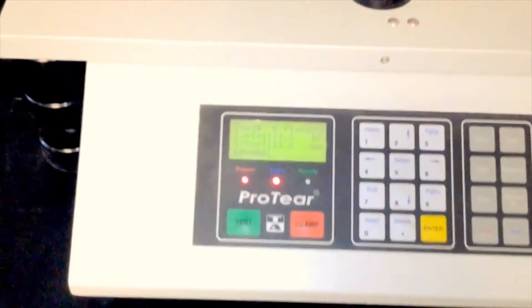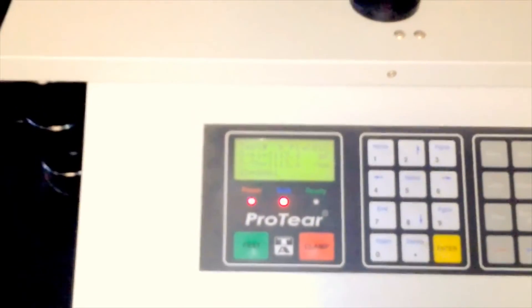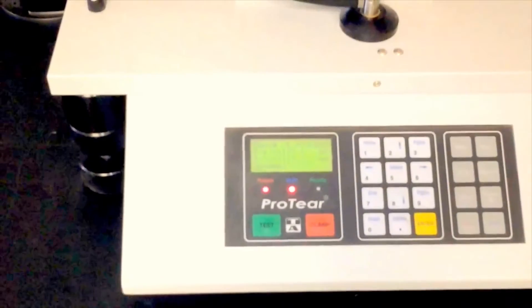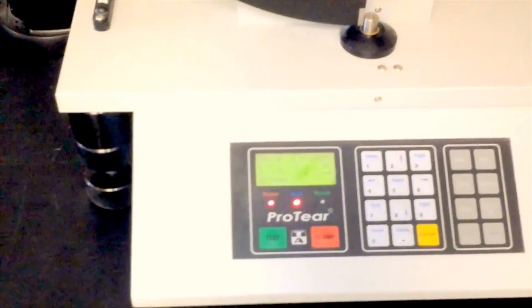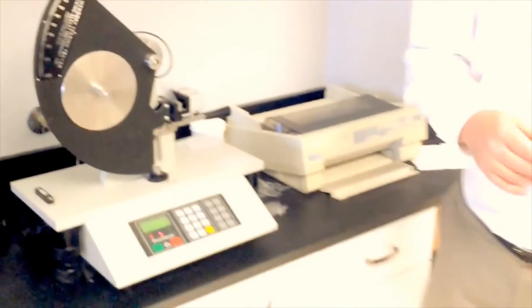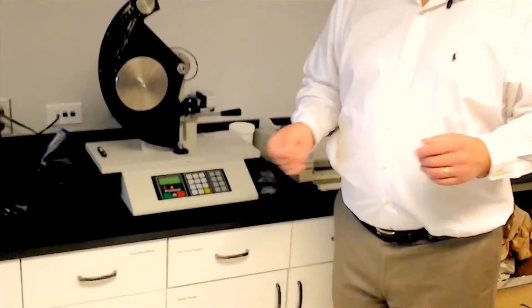And here we have the actual values. I don't know if it showed it, if you can see that, but it says 1113 grams is the amount of force that it took to break that.